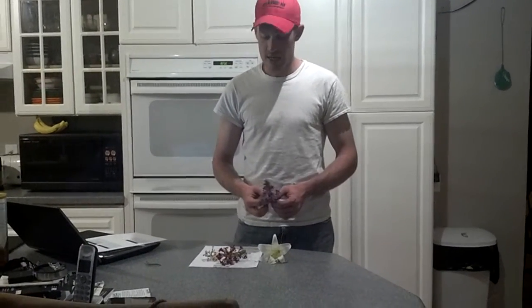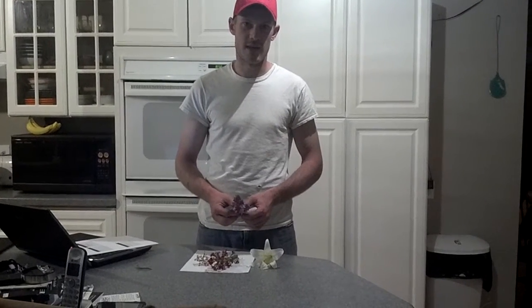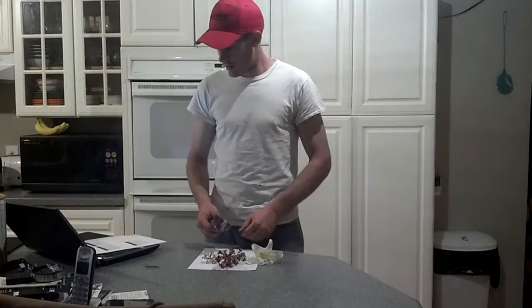For this lab, we're supposed to take 4 flowers, and we're going to examine the reproductive parts on the flowers. And it's just past Easter, so I picked 4 flowers that we had around the house for Easter, and our lilacs just started blooming outside. So I grabbed the inflorescence off the lilac plant as well.